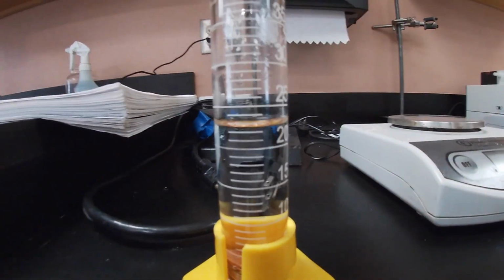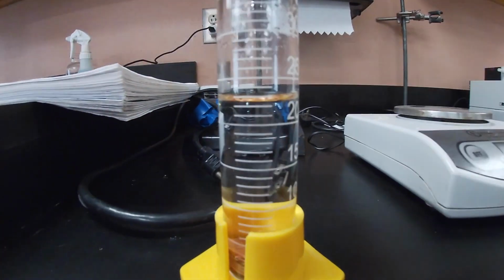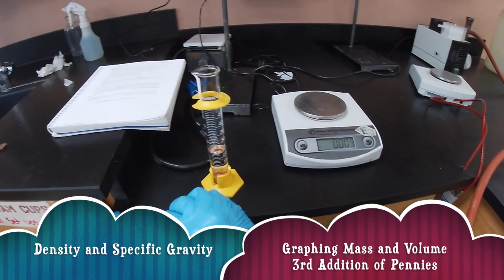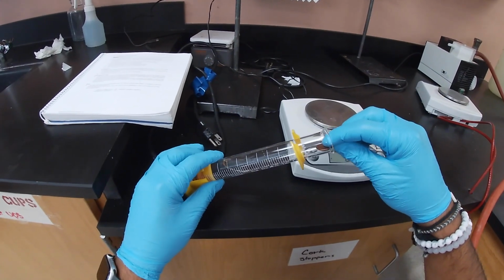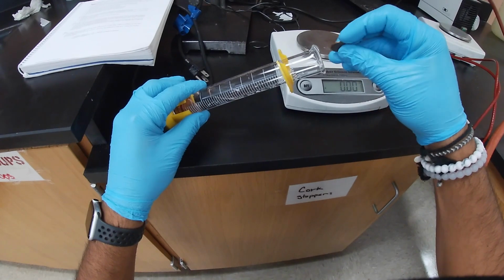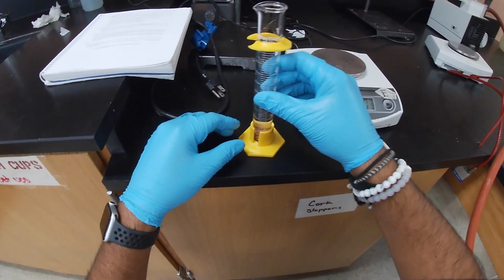Then we do our third addition of the next 3 pennies. So far we have 6 pennies in there, and we're going to add 3 more, so we'll have 9 pennies inside this graduated cylinder. We add 1, 2, 3, and arrange them.